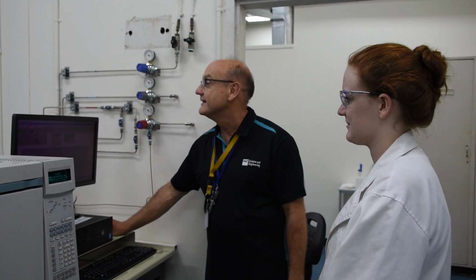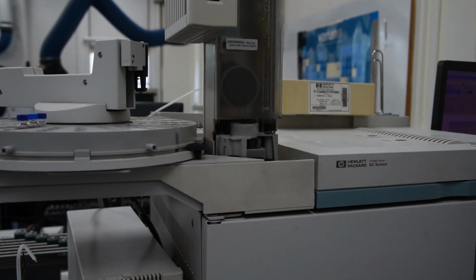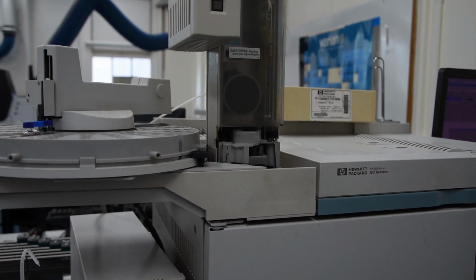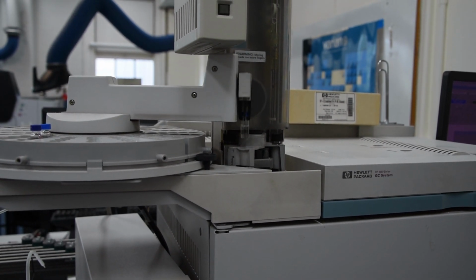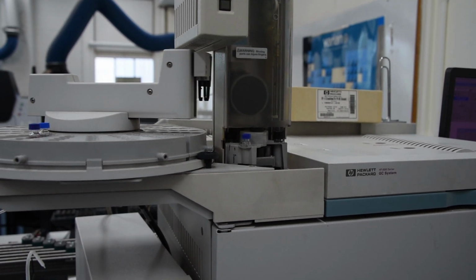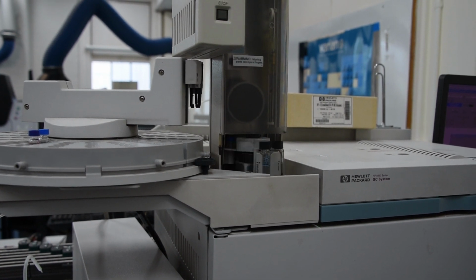In this practical, the GC was set up using the conditions detailed in the laboratory manual. The acetone, calibration standard, and sample were each injected 3 times to enable confidence limits to be calculated. Use the acetone results as the time for the unretained peak and the column dimensions mentioned earlier to calculate the volumetric flow rate through the column.